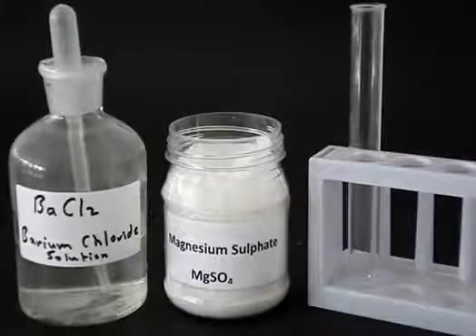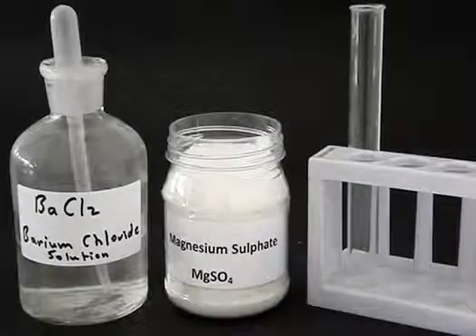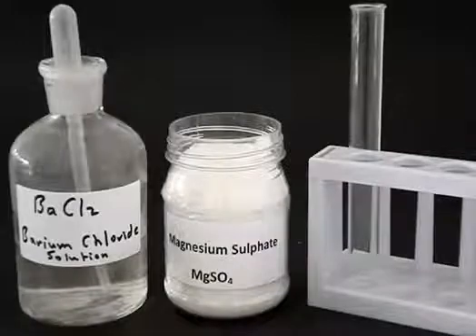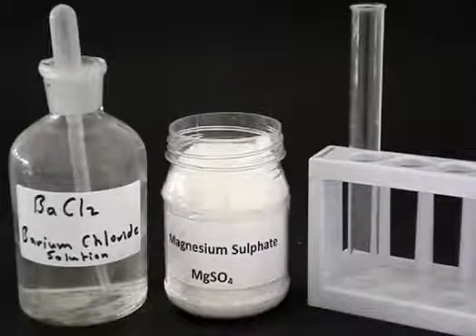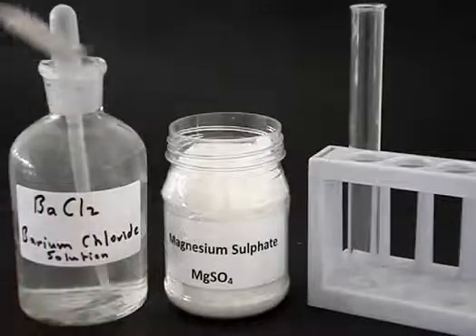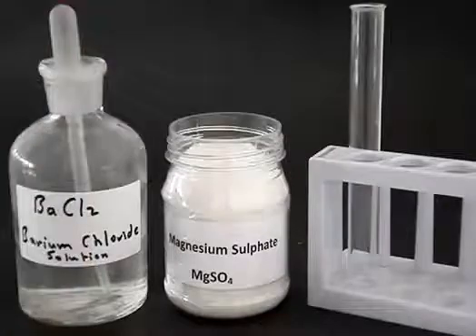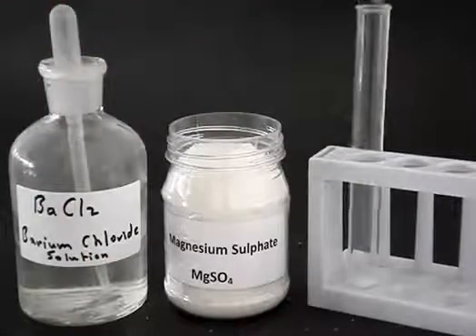Magnesium sulphate is a white crystal. It's an ionic substance, meaning it consists of ions — positive and negative ions — Mg2+ ions and SO4 2- compound ions. If we take some magnesium sulphate crystal, some white powder, and we place it in a test tube, what we're seeing there is magnesium sulphate in the solid phase.